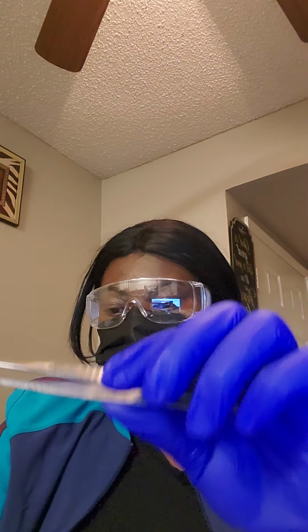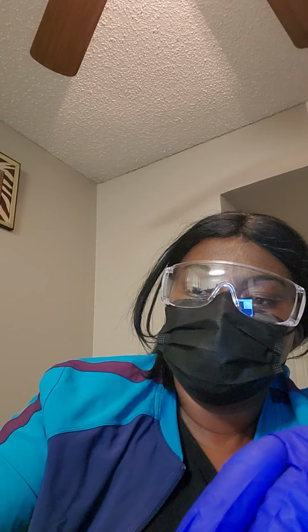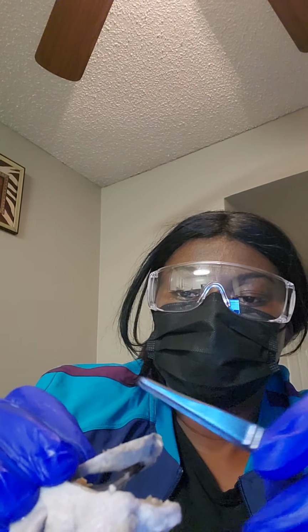And the posterior part of the cavity, when you look through it, when I took out the retina, there's an attachment to it that is attached to the retina, which holds the retina, which is the optic disc, and that holds the retina.